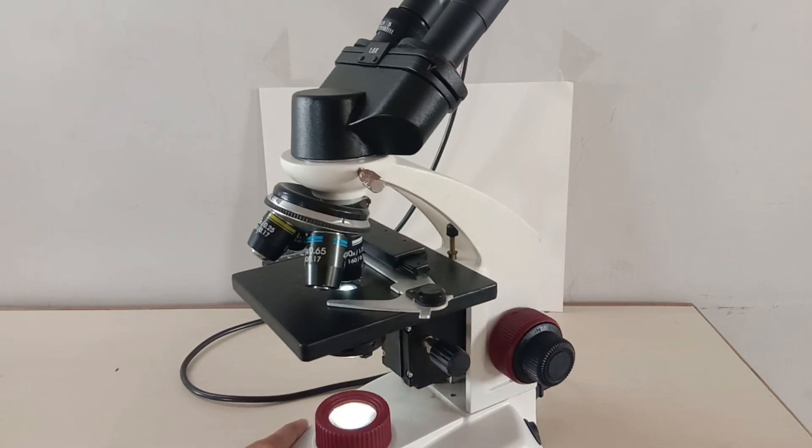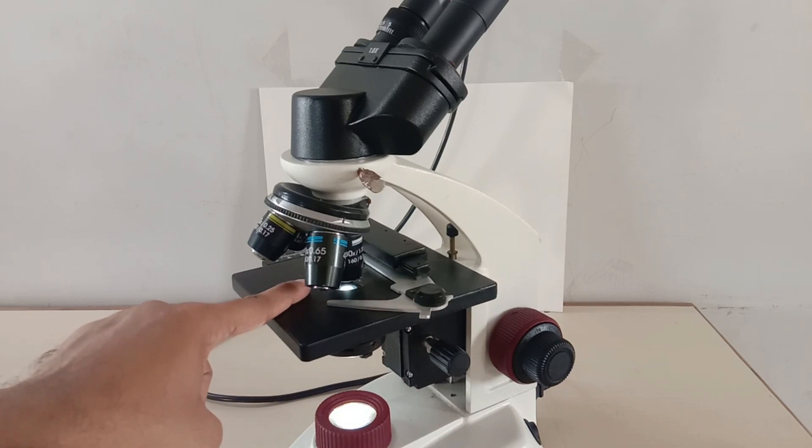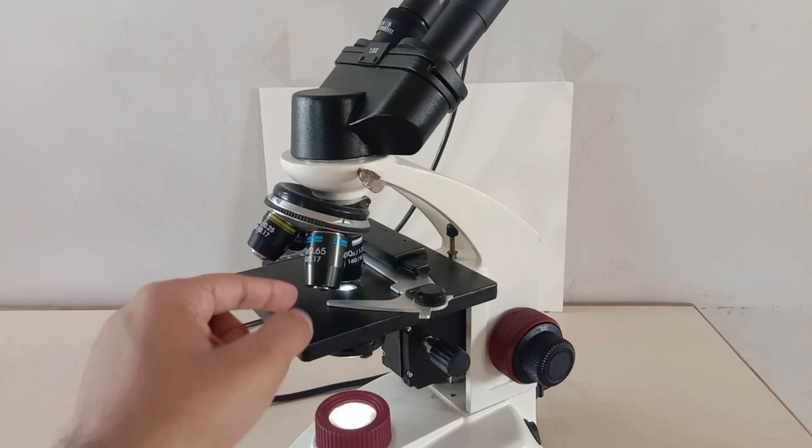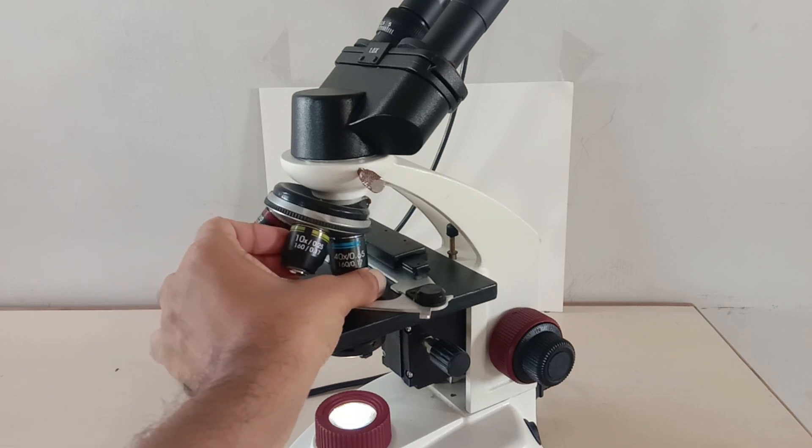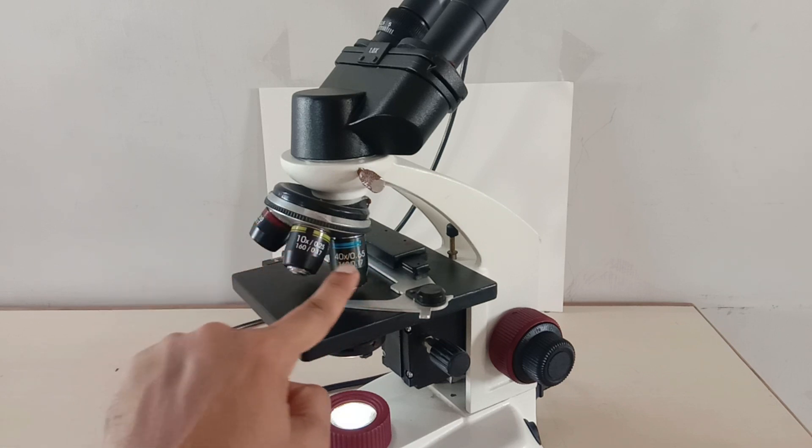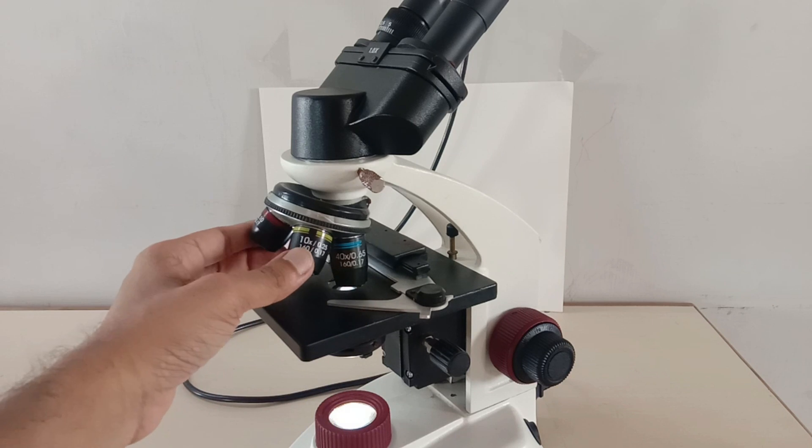This slide will be placed on the stage and the illuminator will emit the light which enables us to see the slide clearly. The eyepiece will provide the magnification of 10 while the objective provides the magnification of 4, 10, 40, and 100 respectively.